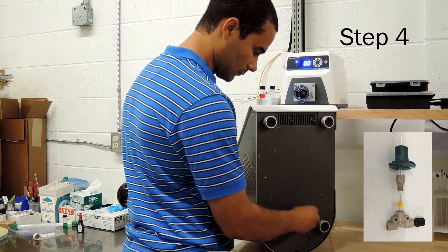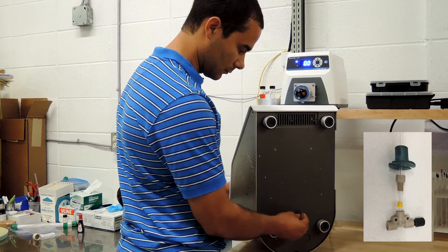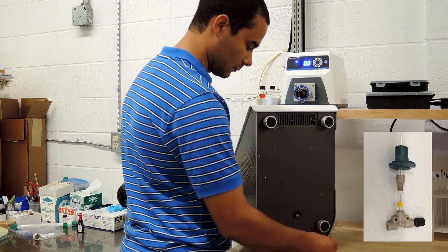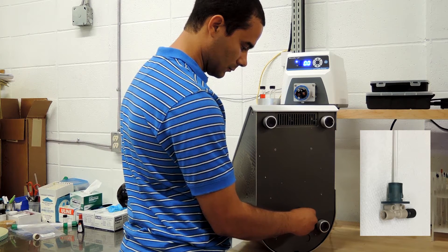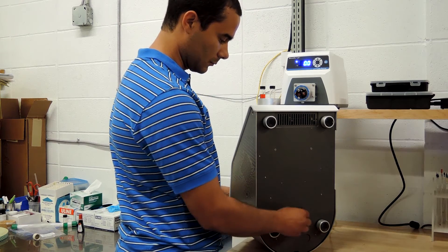Once it is in, you can fit the appropriately sized ferrule over the flow cell — tapered side into the hex adapter — and then screw on the bottom 90 degree fitting. This can either be an elbow or modified T joint. Once it is tight, you can gently wiggle the flow cell and see corresponding movement at the base. This indicates it is fully sealed.